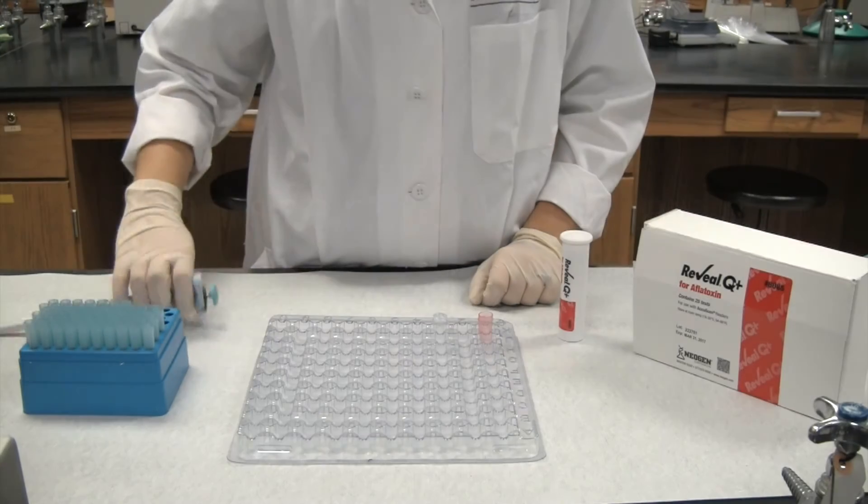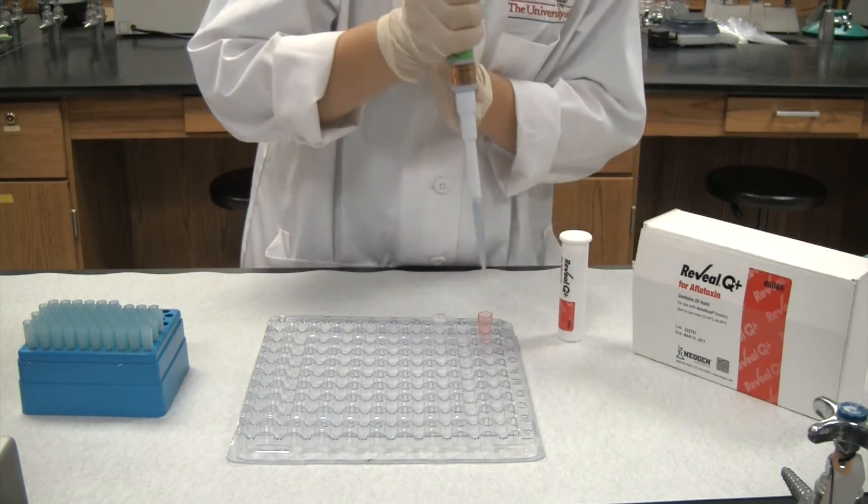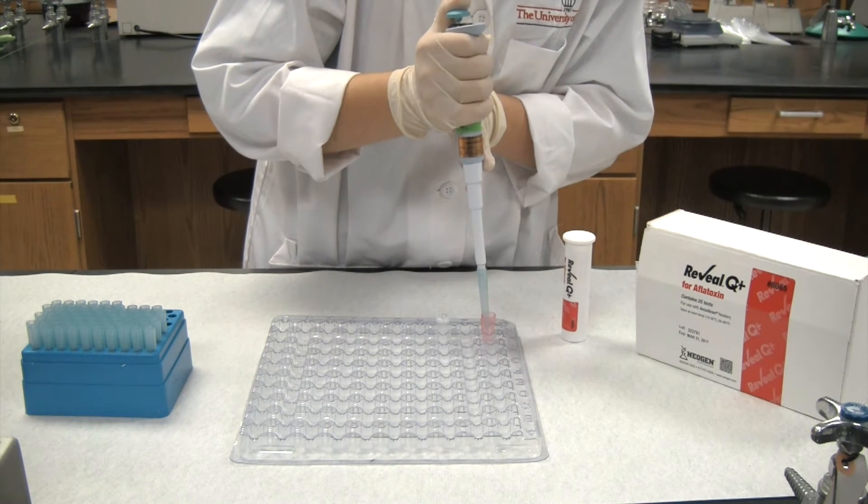Now, using another pipette, take 100 microliters of the mixed solution and add it to the provided clear cuvette.